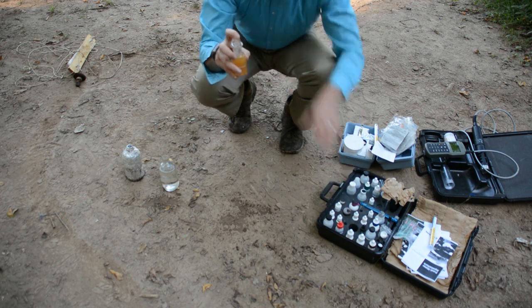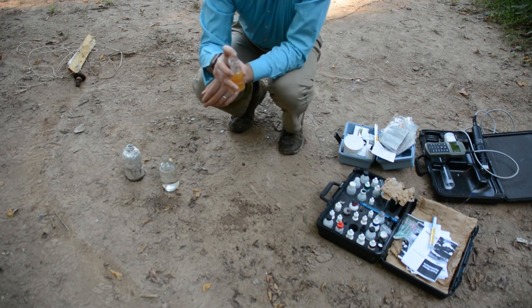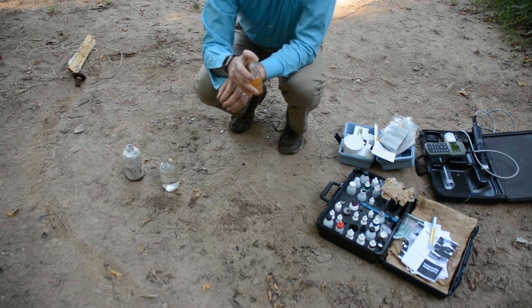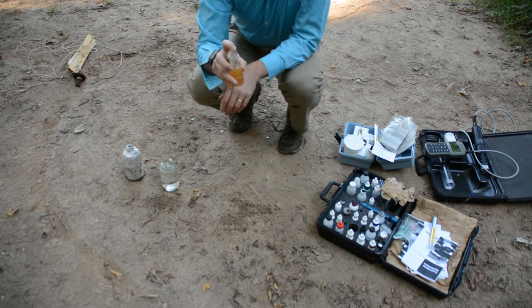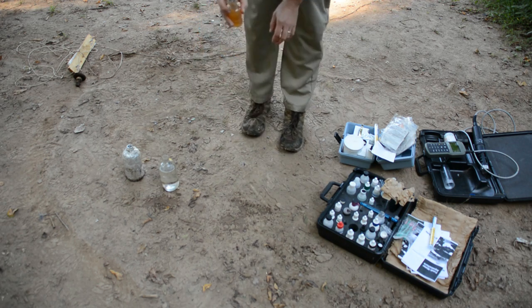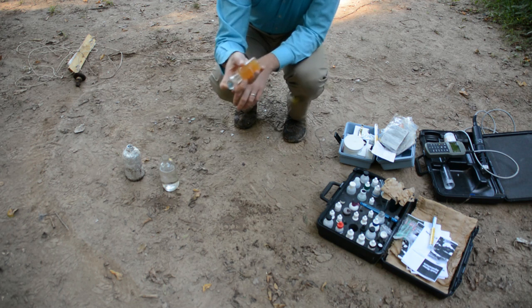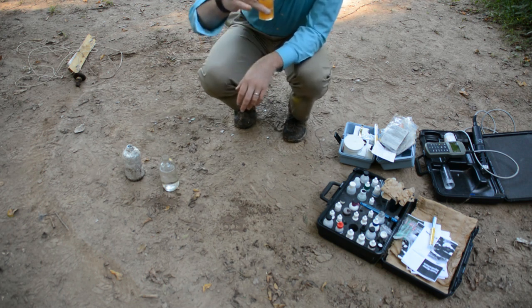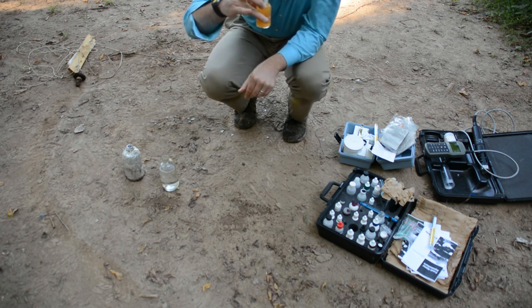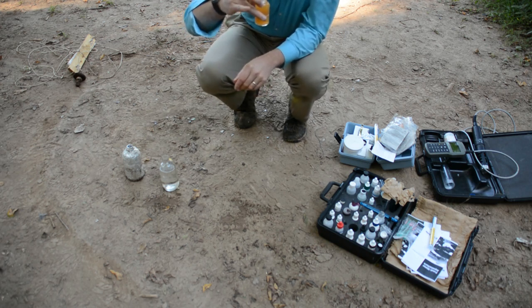The LaMotte chemical test kit will use a sulfuric acid and stabilizer, and then what we will do is, again, this one's a little bit more calibrated of a titration. Again, we're looking for a color change. Sorry, my knees are hurting a little bit, I have to stretch out. We're looking for a color change, and this will sit now, letting the solid flocculant drop down and precipitate out, and then we'll sample the water above it.